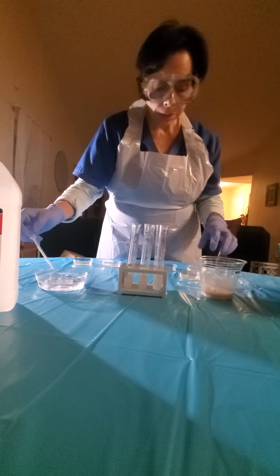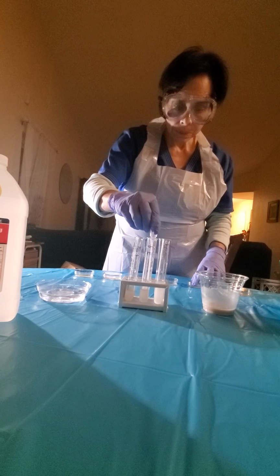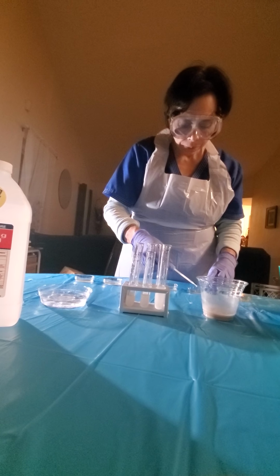So that's wash. Then we're gonna go to number 2. Same process, I only need 4 drops.